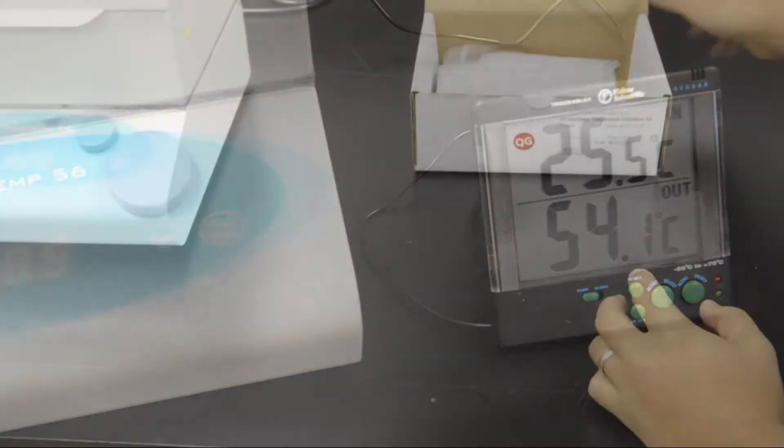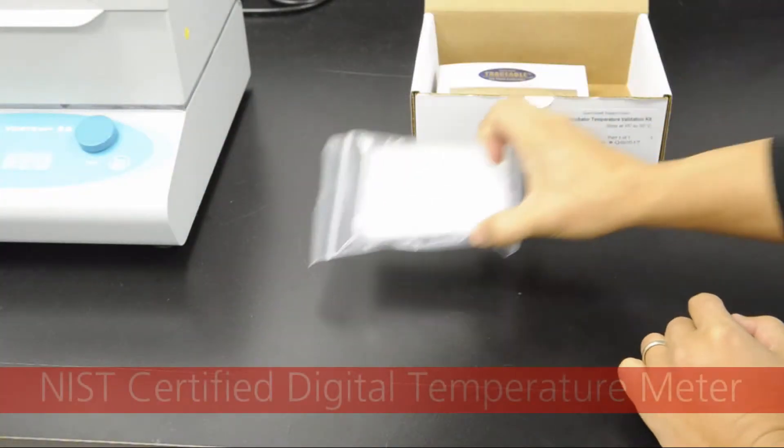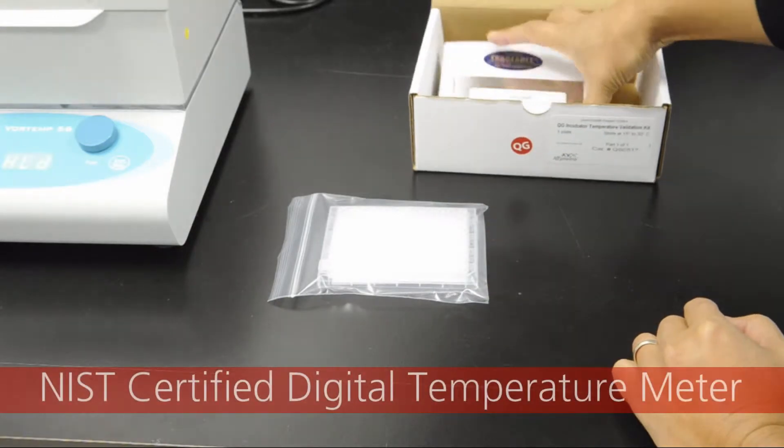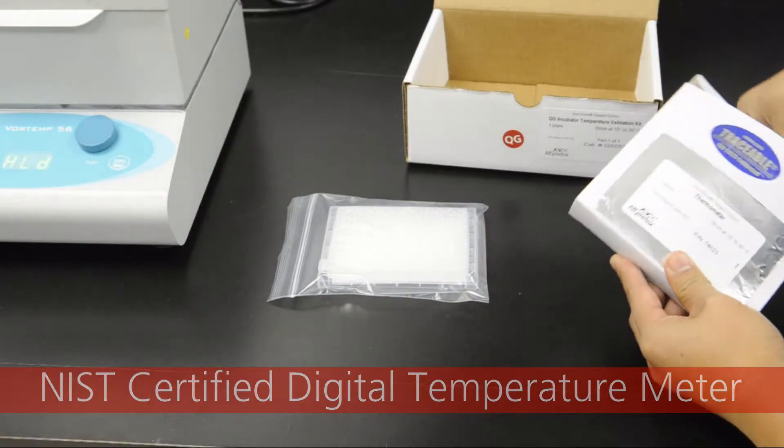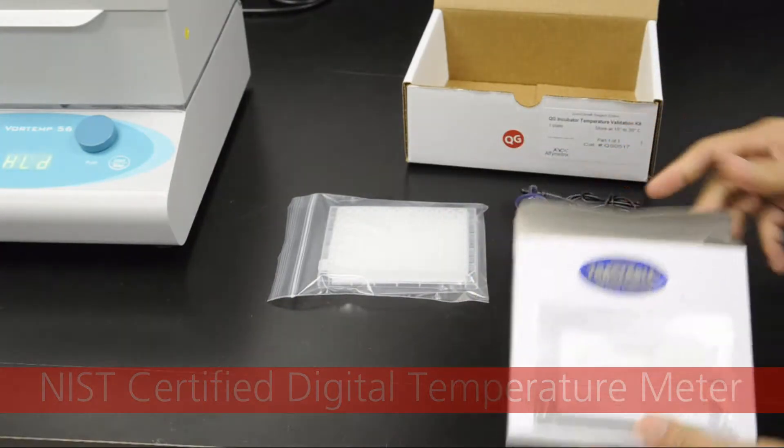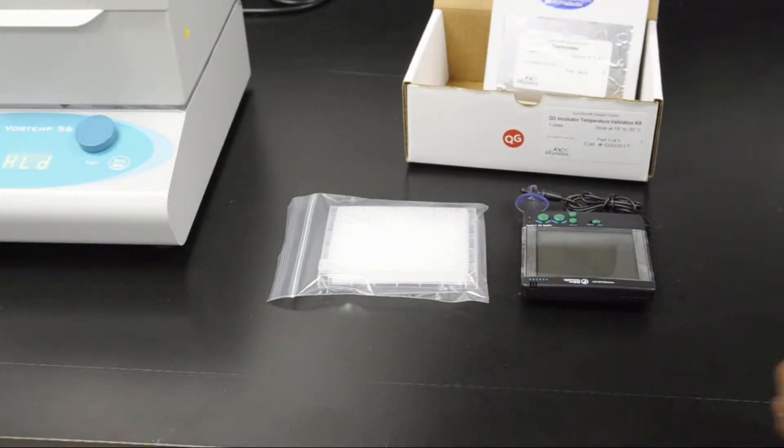The temperature validation kit provided by Affymetrix uses a National Institute of Standards and Technology, or NIST-calibrated digital temperature meter to assess the accuracy of the temperature.